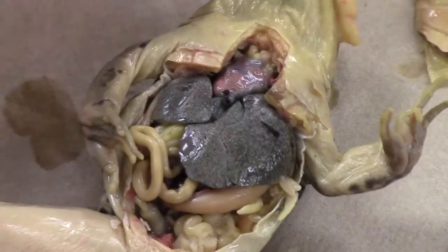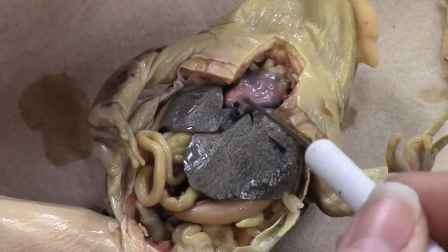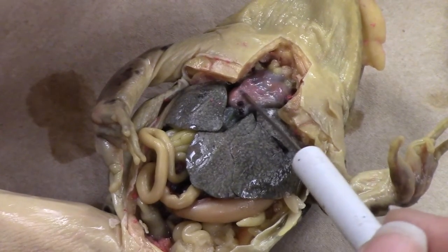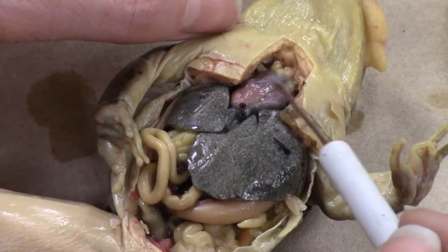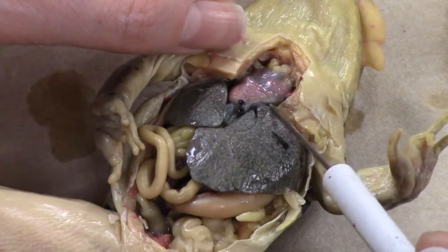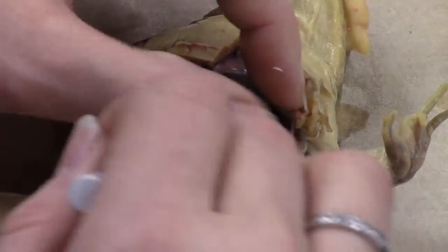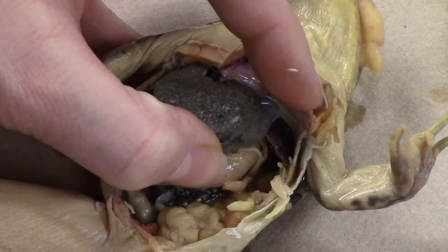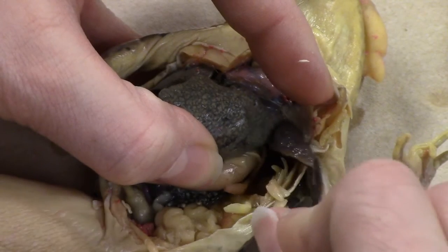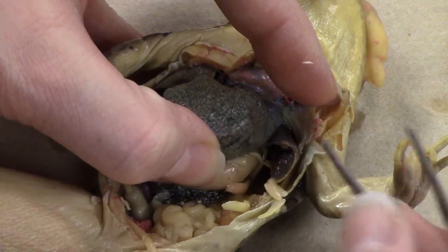You might have to go up a little higher in order to see the heart. Now you can actually see the whole entire heart — it's been dyed. Yours may not be this bright red — it's not blood, it's like colored wax that they injected so you can see it. It is inside a kind of bag that holds the heart in place. The only other thing up here we need to find are the lungs — I like to compare the lungs to shriveled-up armpit raisins. And here is a lung — kind of brown, kind of shriveled, literally up in the armpits. There should be a matching one on the other side.